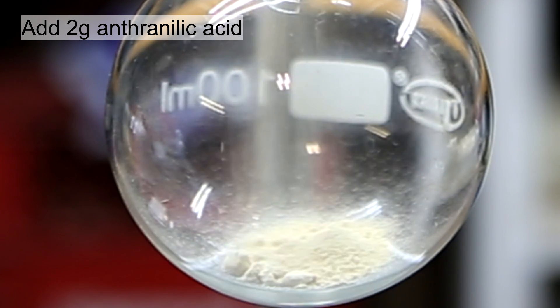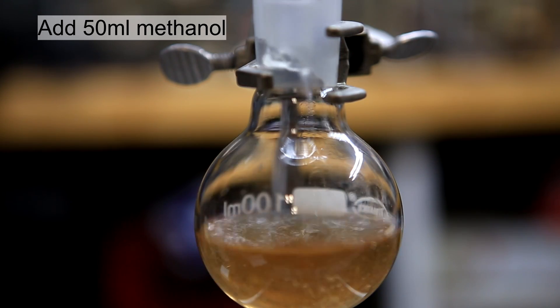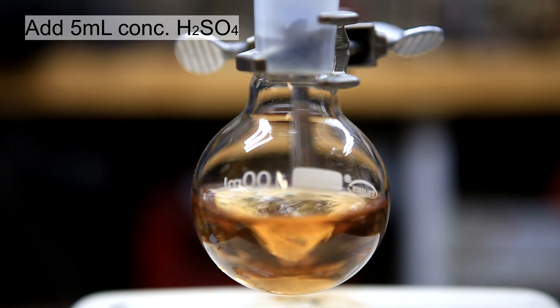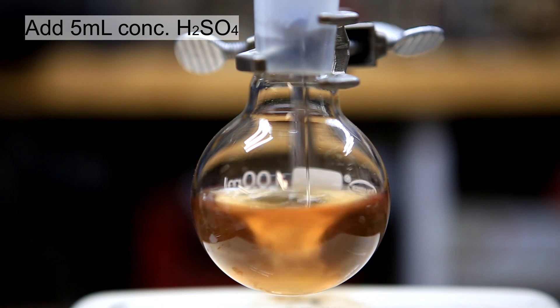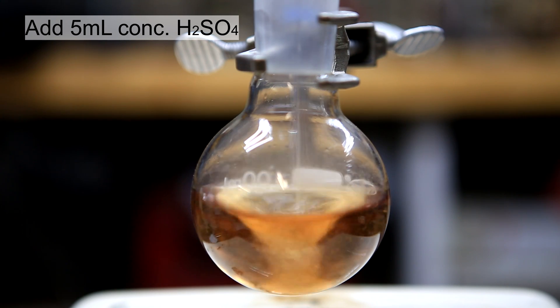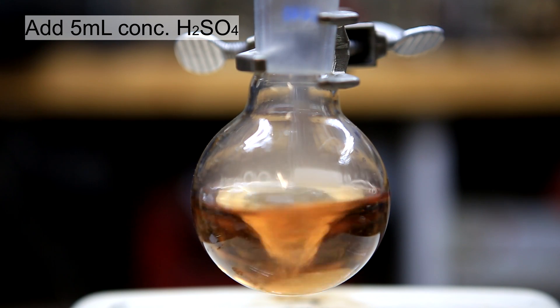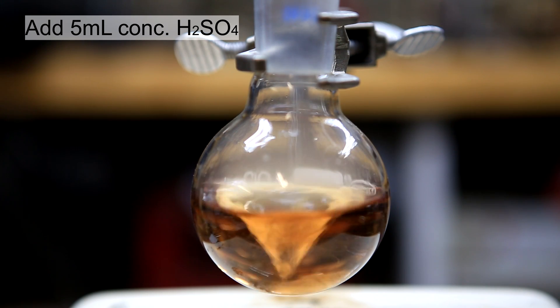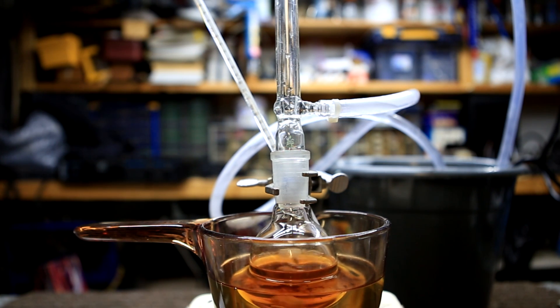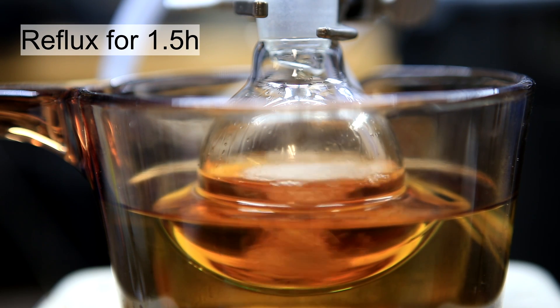We start off by adding 2 grams of anthranilic acid, followed by the addition of 50 milliliters of methanol. With rapid stirring, 5 milliliters of concentrated sulfuric acid was added. The purpose of the sulfuric acid is to act as a catalyst. A condenser column was then attached and a reflux was carried out, with strong stirring, for about an hour and a half.